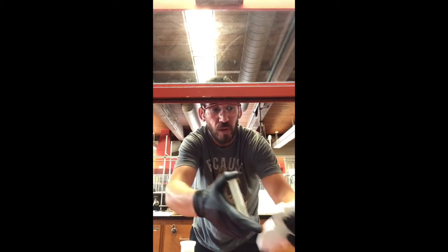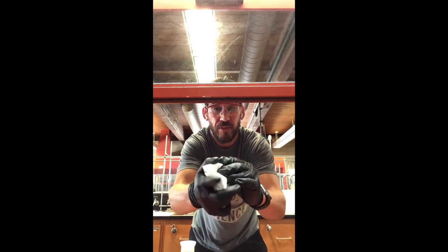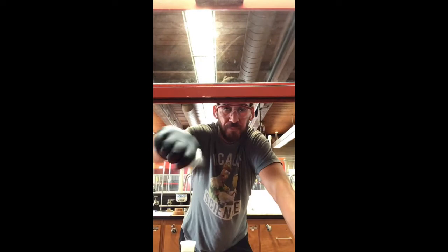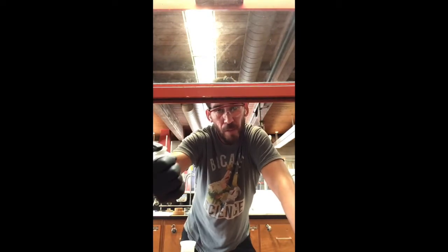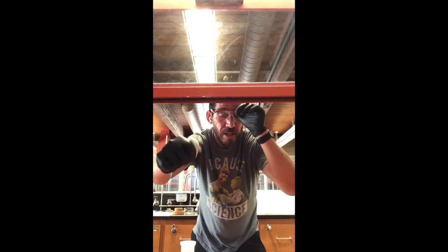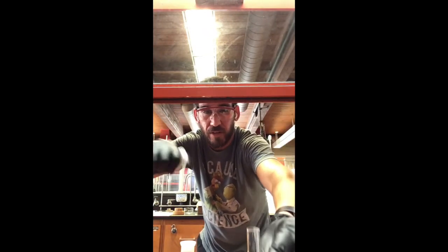So what we're going to do is do this a total of 3 times. Okay? And so now I'm putting the paper towel on there, and I'm going to invert that a few times. Okay? We're going to do this for about a minute, and then let the 2 layers separate again, and then we'll transfer about 2 mils of methylene chloride into the same test tube as the original 2 mils of methylene chloride, okay?